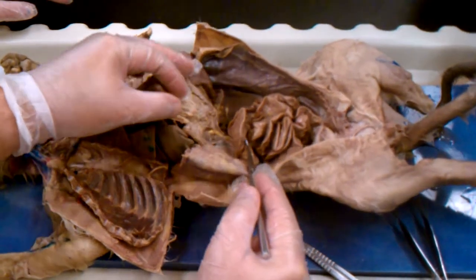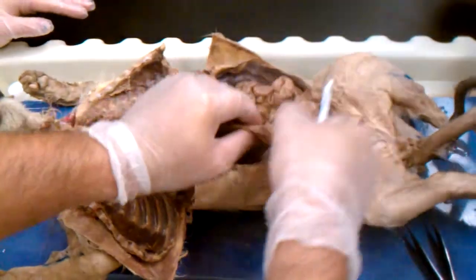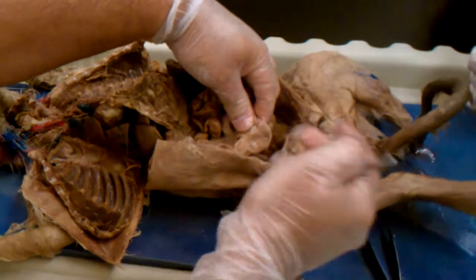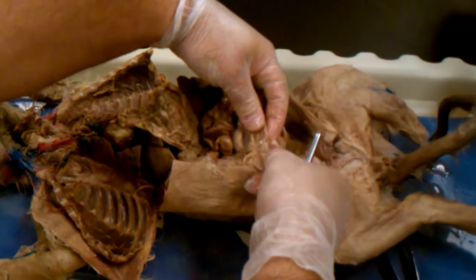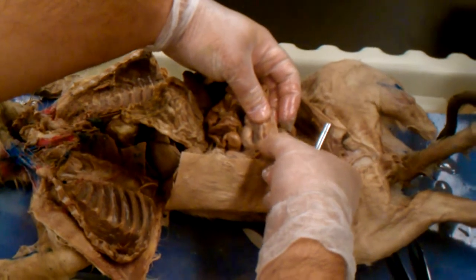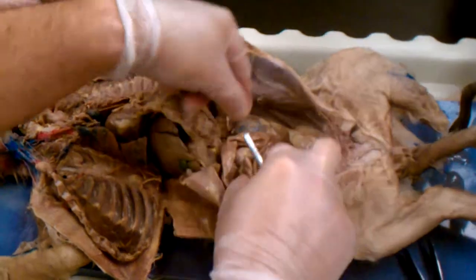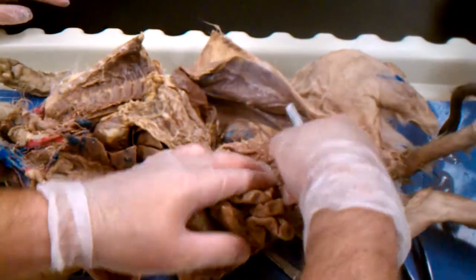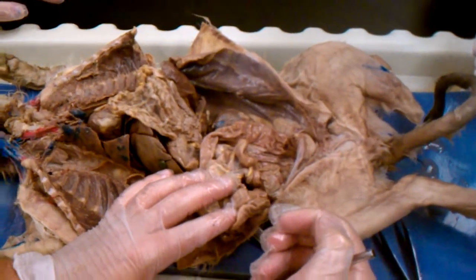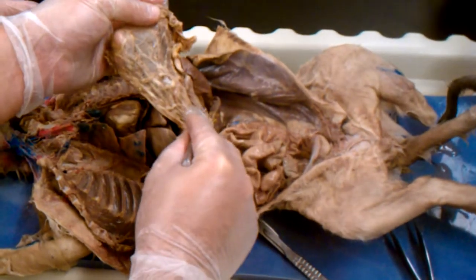This right here would be the ileum. This would be the cecum, sometimes called the blind sac. This right here would be your sphincter, called the ileocecal valve. From there, we have our ascending colon, transverse colon, descending colon, sigmoid colon, rectum, and then anus. Can you say anything about the pancreas again? The pancreas is underneath the greater omentum, and it goes from below the stomach all the way to the duodenum. Okay, the small intestine is here. That's your flower. That's your mesentery.